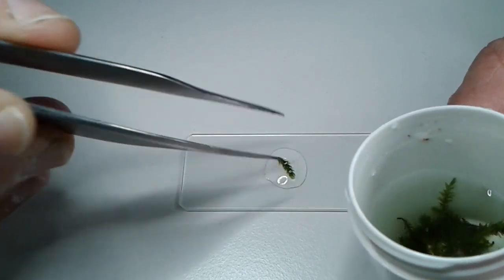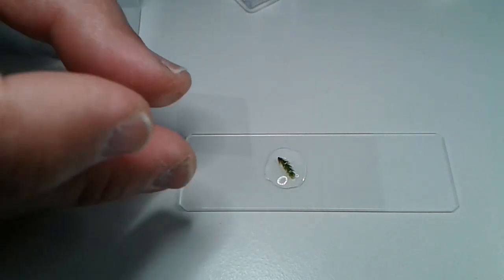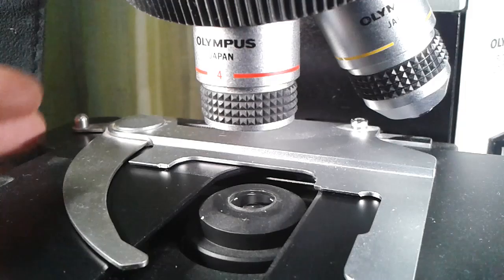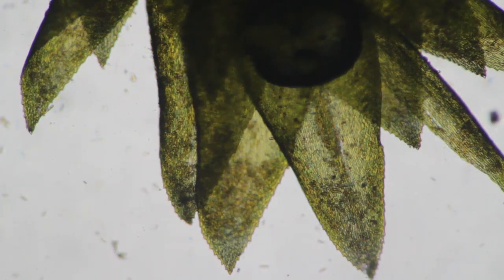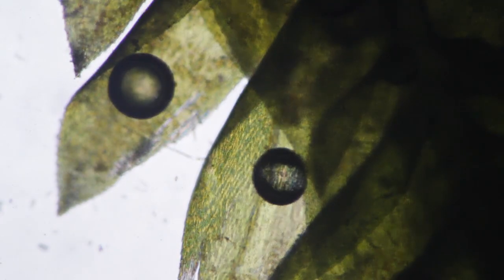I think this specimen here is way too thick. Let's try it anyway and see how successful it is. First of all a small cover glass — and of course it's too thick. I mean we can see it's not going to work well, but let's have a look anyway. Maybe there are some organisms on the surface of the moss that we can see. As expected, the specimen is a little bit thick, but we can almost see the individual cells already. There are some air bubbles here — the large round structures are air bubbles. If I do a time-lapse maybe I can actually see them grow as the moss produces more and more oxygen. That would be quite interesting to observe.